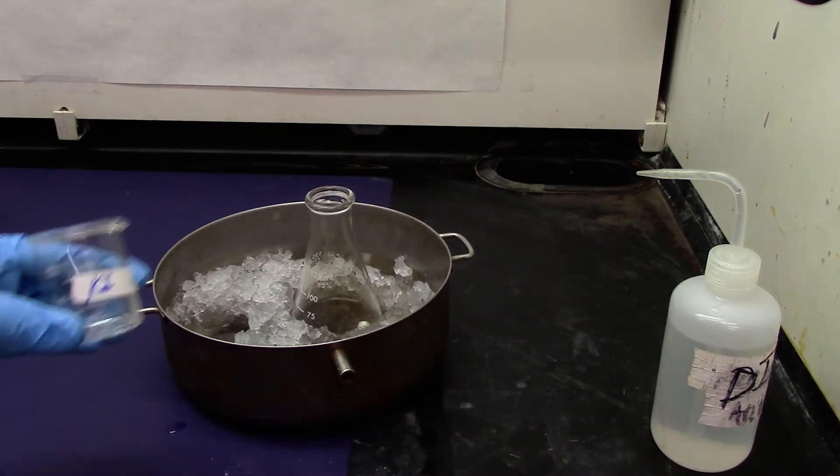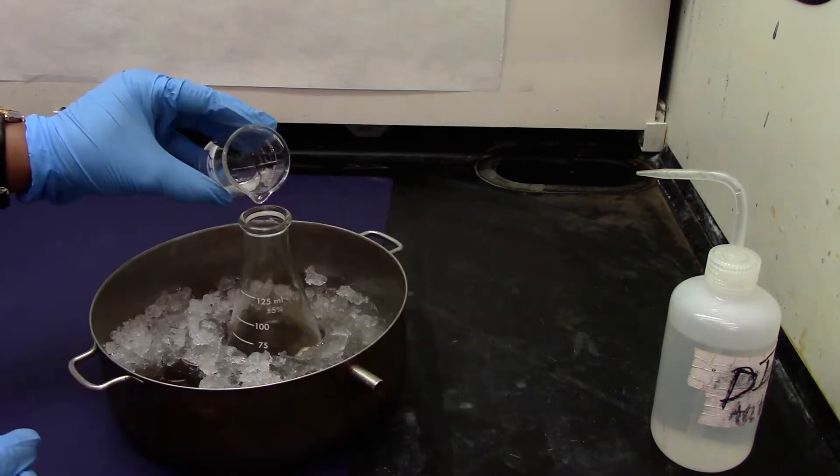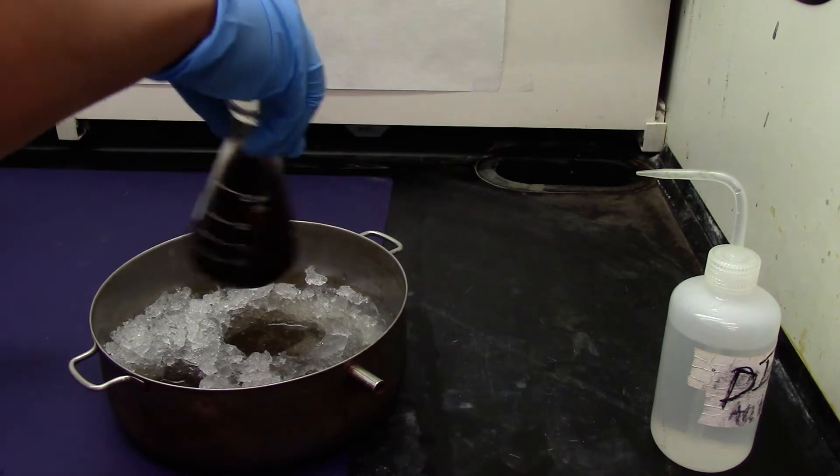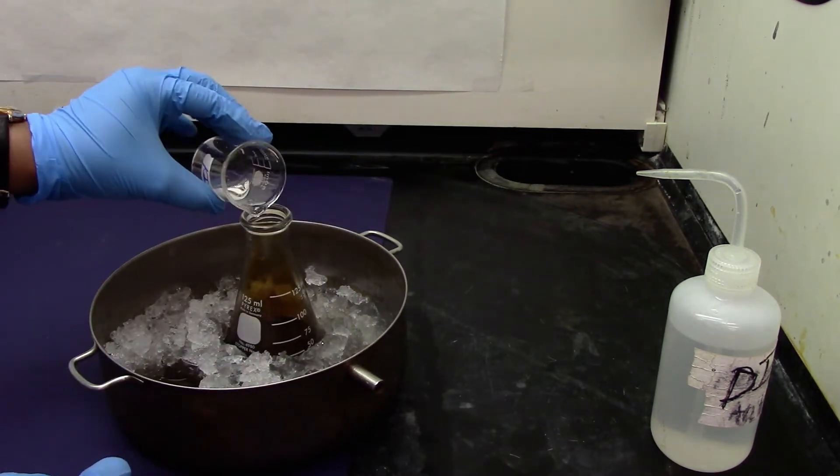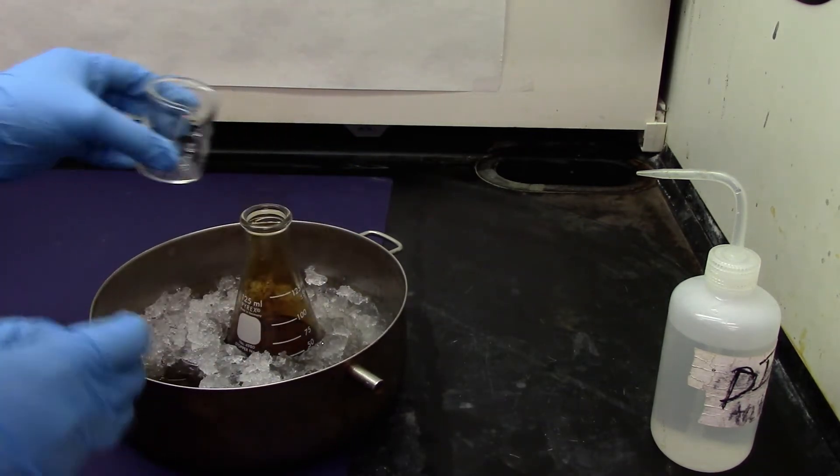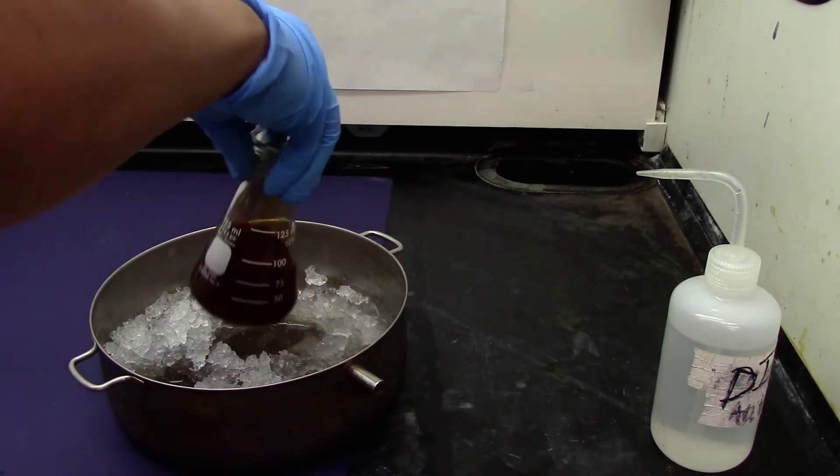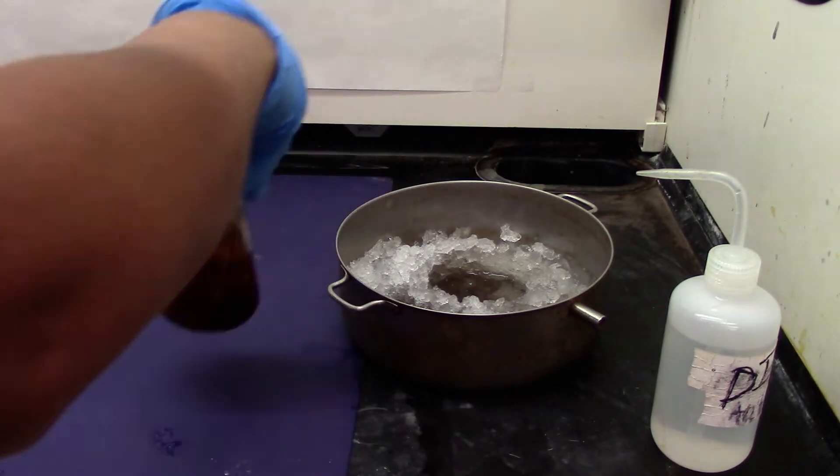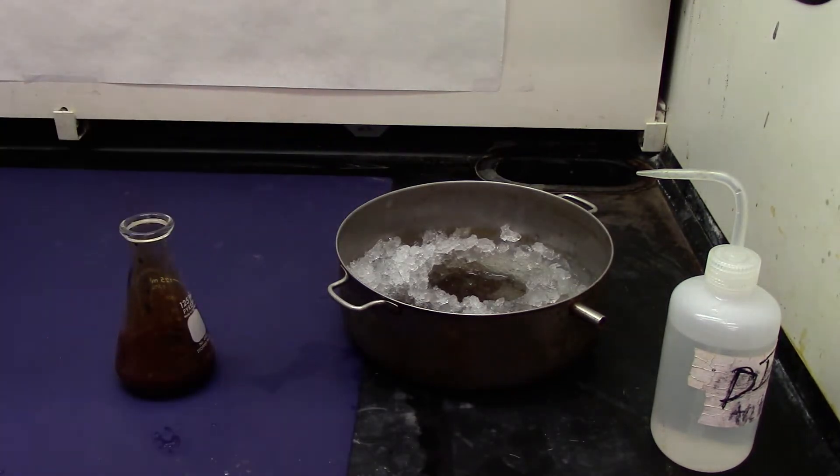I'm going to add my potassium iodide solution. As you can see a tan solution is being formed. And I'll let it stand for some time.